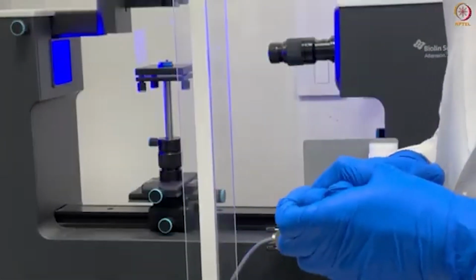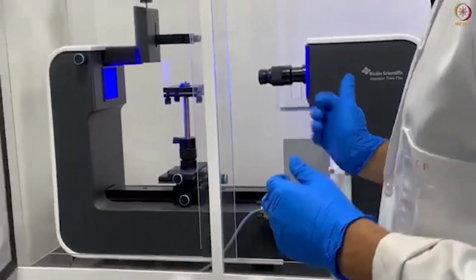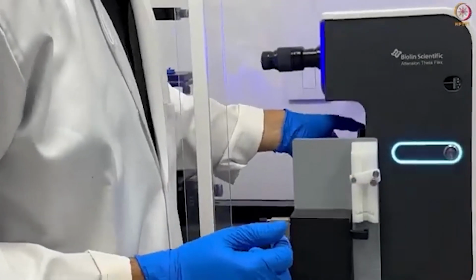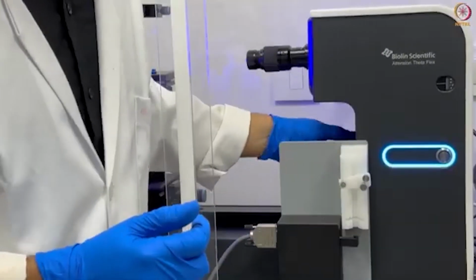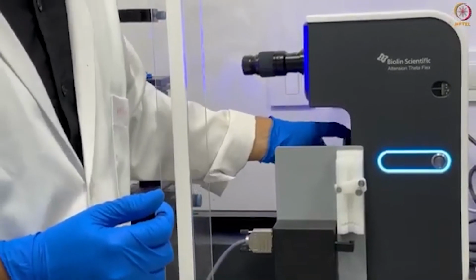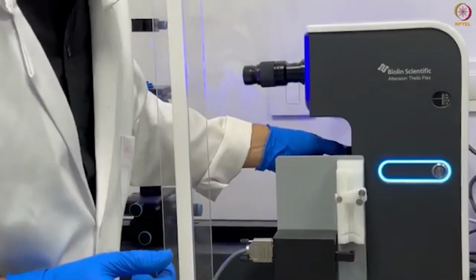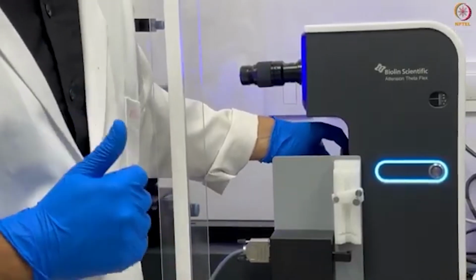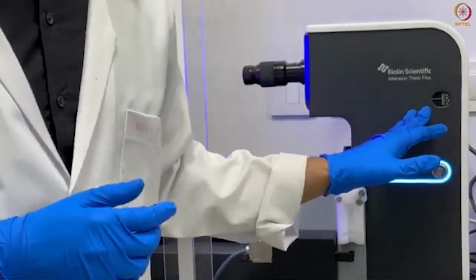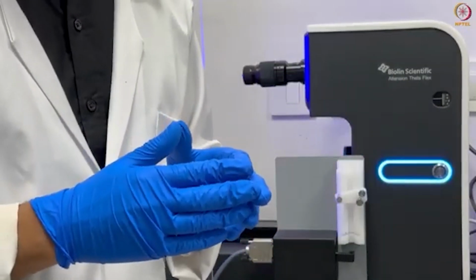Remember, for calibration, as I told you, for drop measurements, we have to maintain the tilt of our camera at -2. Now we will rotate to -2. By rotating the roller clockwise, you can change the tilt angle of your camera. I'm setting this at -2. As you can see here, this is the scale that shows the tilt of your camera. So here, the scale is at -2. Now our camera is set at a -2 degree tilt angle.